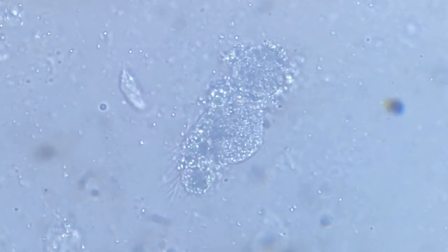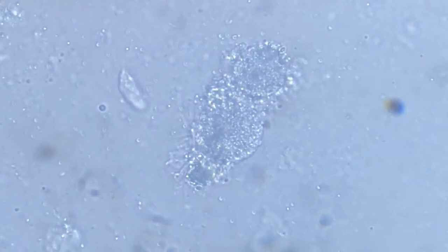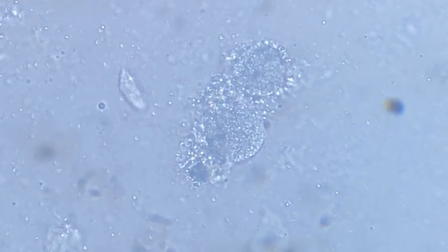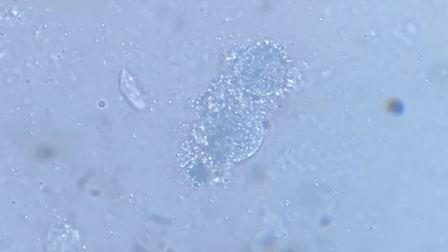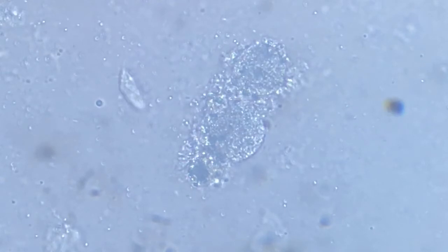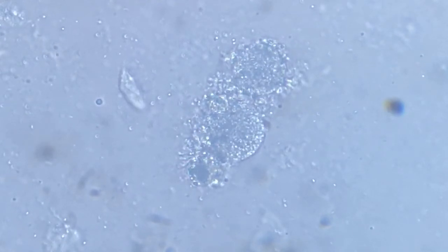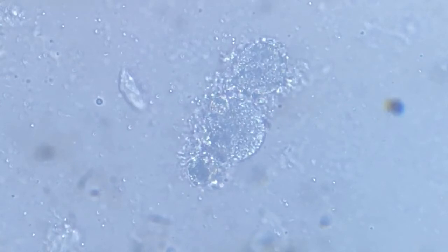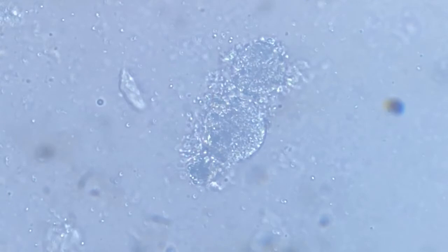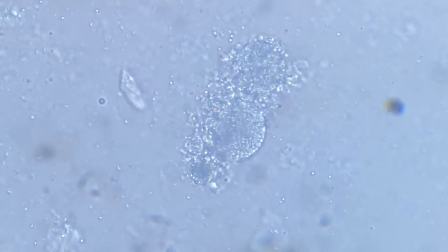The pellicle is collapsing, giving way to the protoplasm. The protoplasm will be in a random movement because those substances still have charge differences and osmotic differences. As a result, they shall keep on with some randomised Brownian motion for some time.